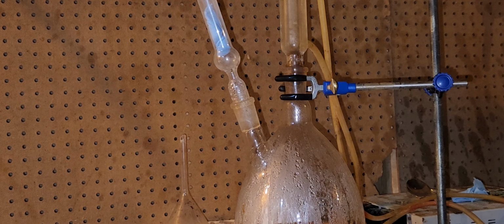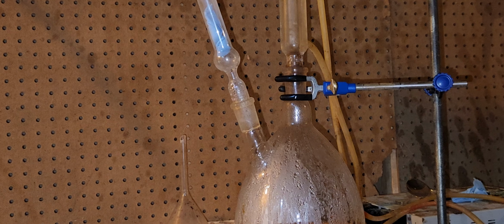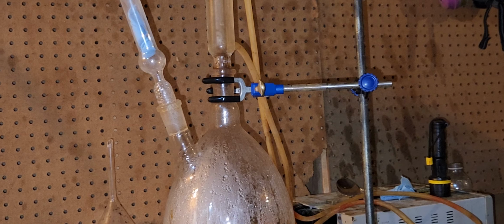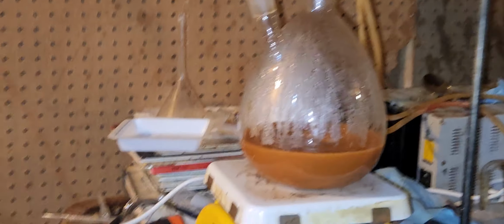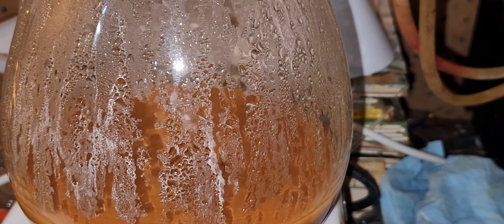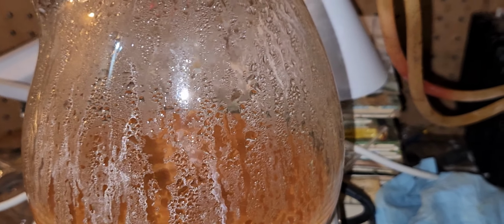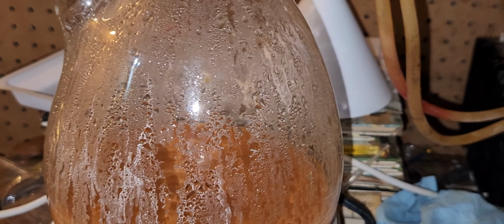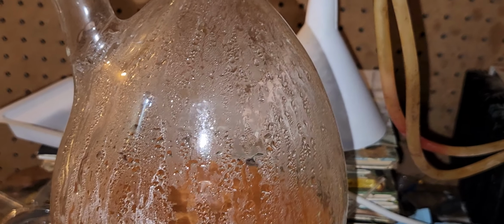Now, what does this really mean? Well, the vanadium requires high temperatures. Vanadium pentoxide requires at least 110 to 120 degrees Celsius of heating. And sorry, I think about 30 or 40% of the vanadium pentoxide stuck to the flask when I was doing it before.